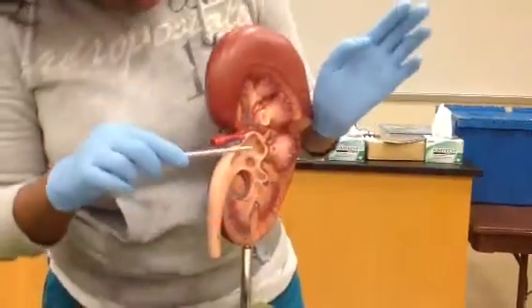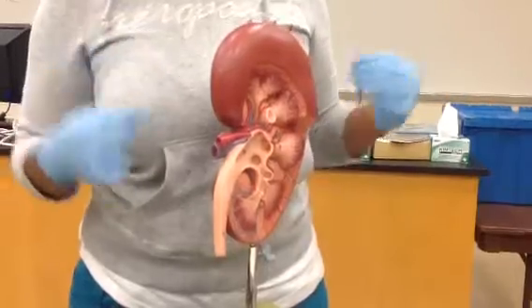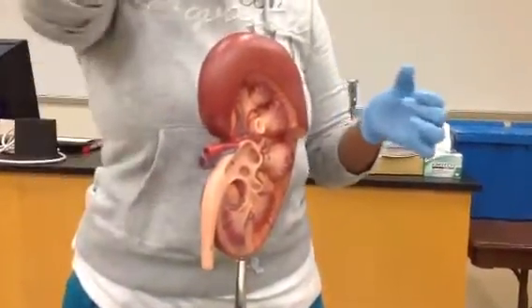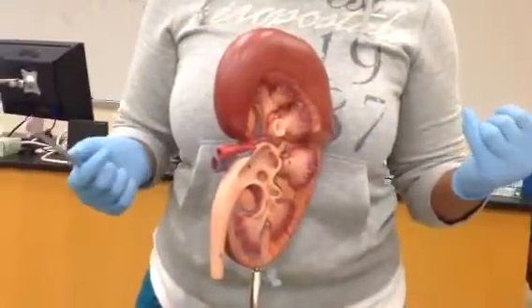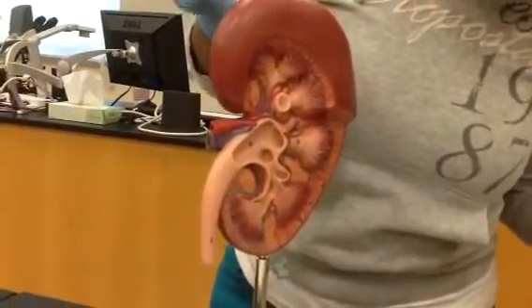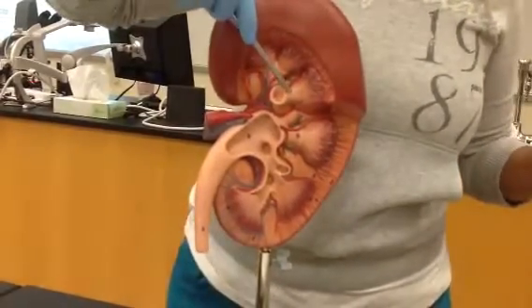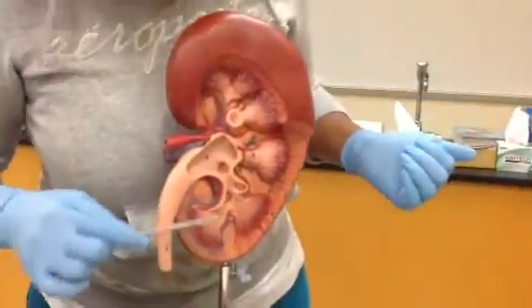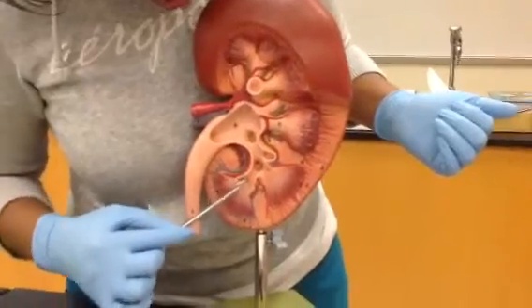Also on here you can see the renal papillae. So you see those little holes underneath each renal pyramid. That's where your collecting ducts are all funneling out through those holes, those pores, and they drain into the minor calyx. So that's what those holes are for. Can you point to the pores again? Do you see, a renal pyramid has been removed here, so you can see the pores actually in the calyx. So that's what that's talking about. All of this is considered renal papillae.